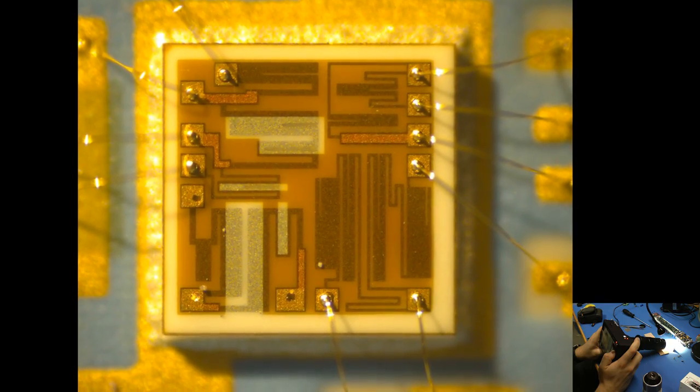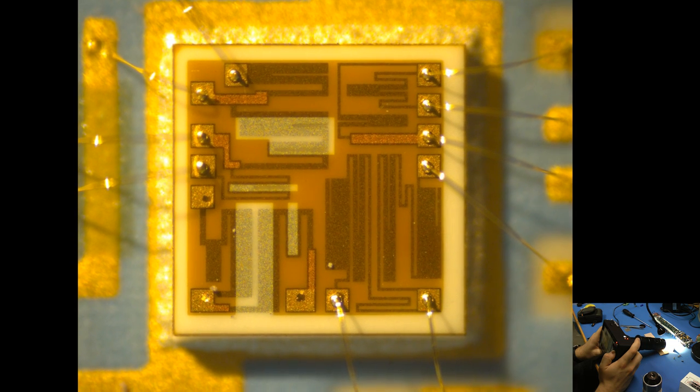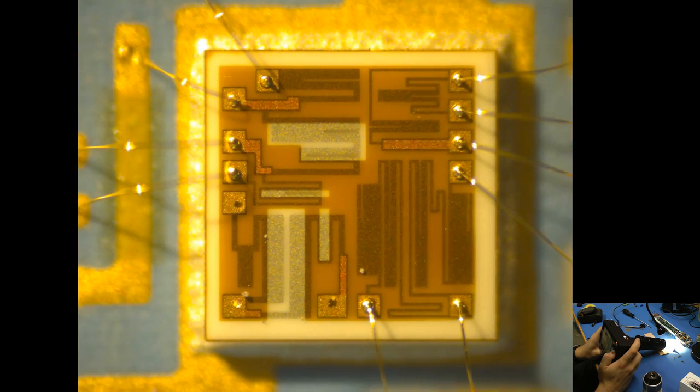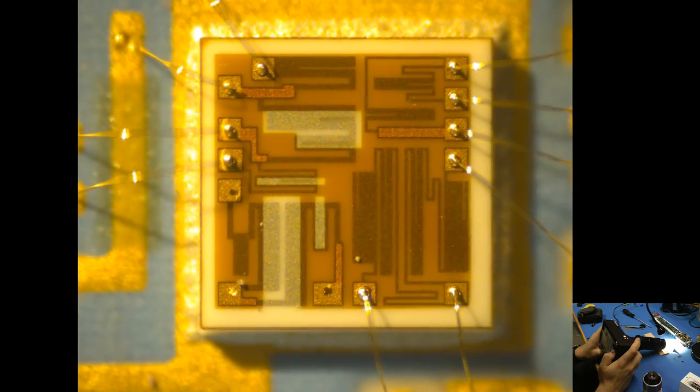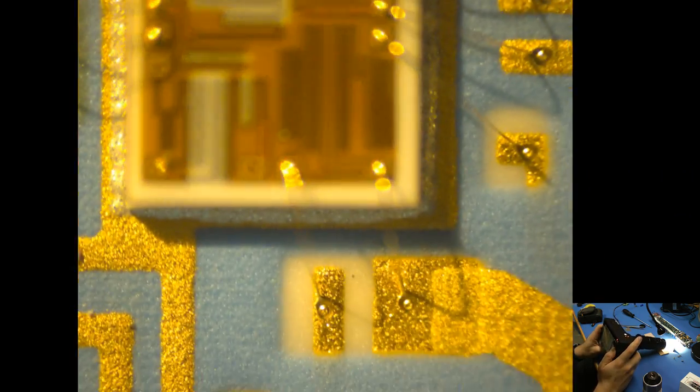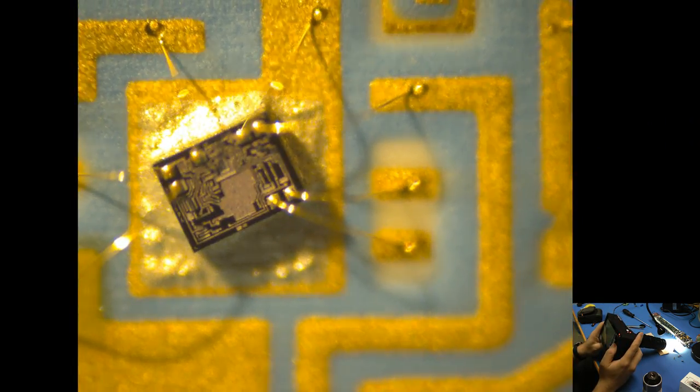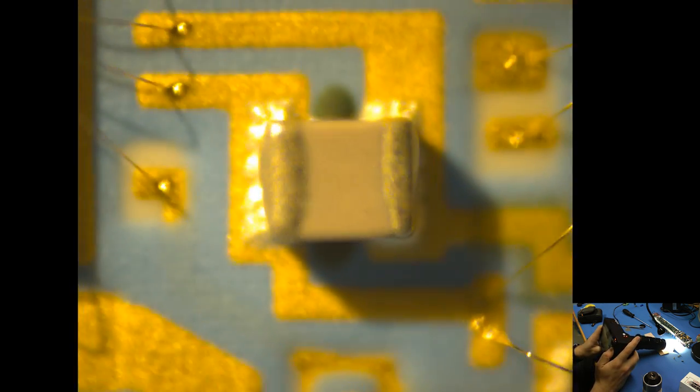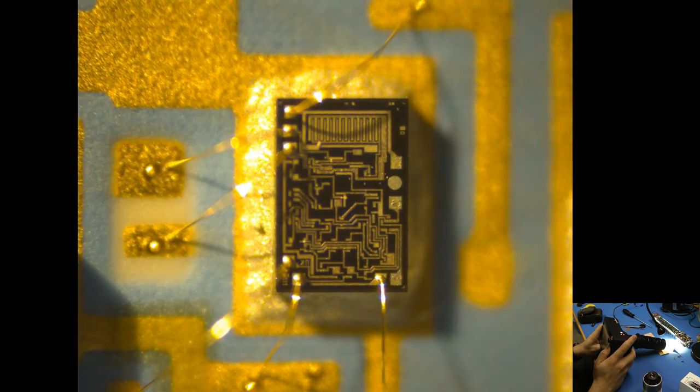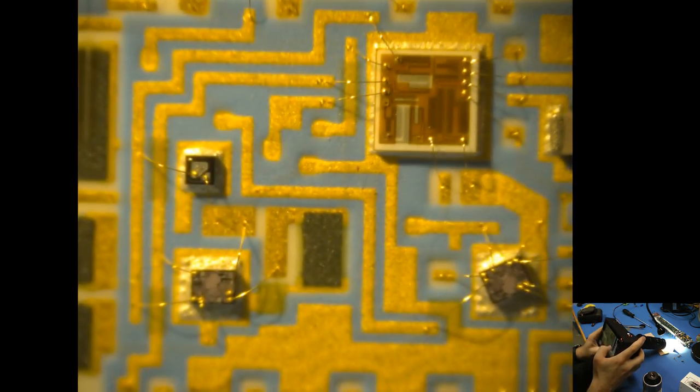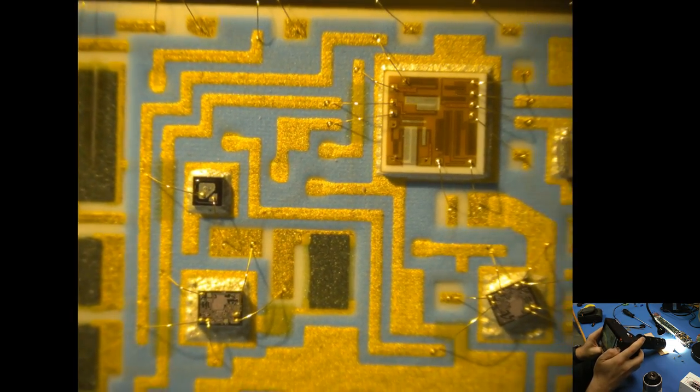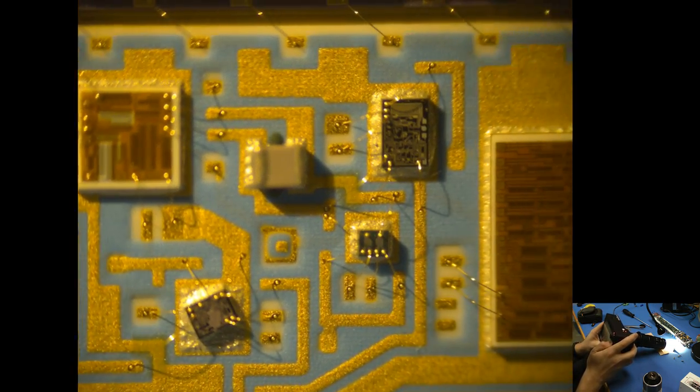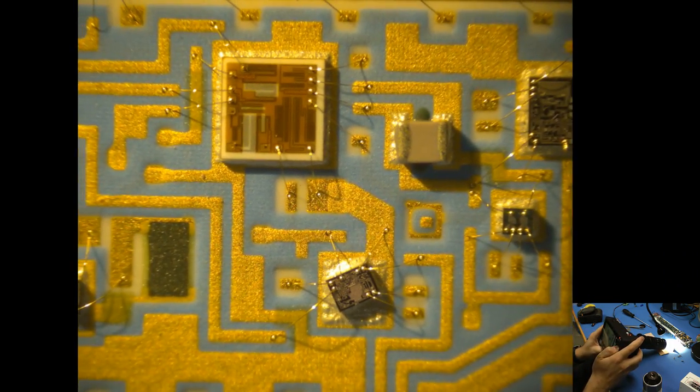Here's the other laser trimmed part. Pretty similar. Looks like it has some exposed sections. Everything else is covered under some sort of like a solder mask. Not much, pretty similar to the other one. Also we got, there's a small die, it's probably an op amp or something. Another one over here. And that's just a cap. Yeah. Another probably an op amp. And somewhere, yeah, it's not all that much else. There's a few what looked like diodes or transistors. But yeah, that's pretty much everything that's on this hybrid chip.